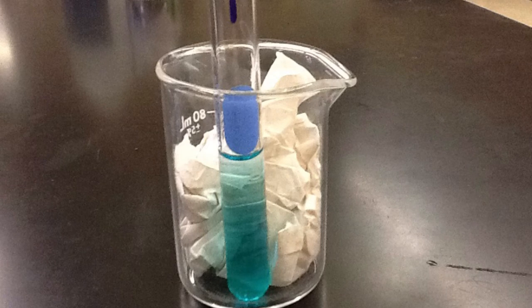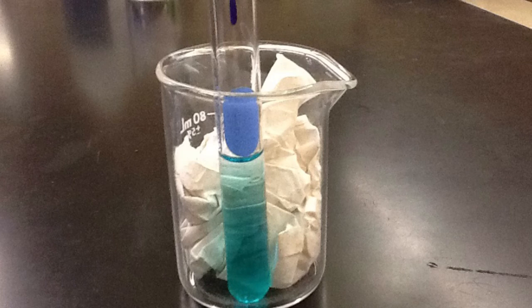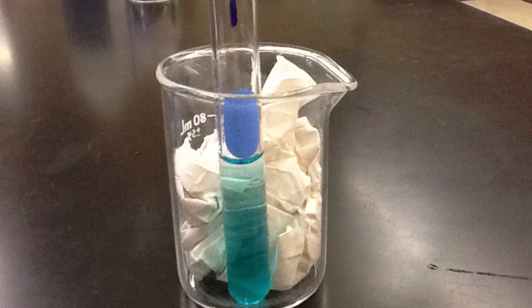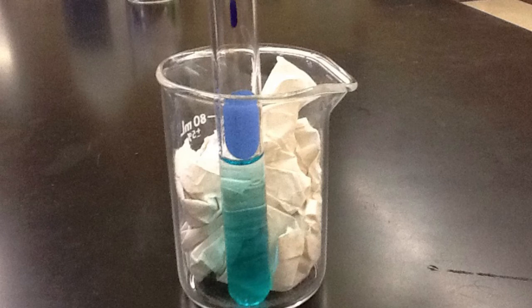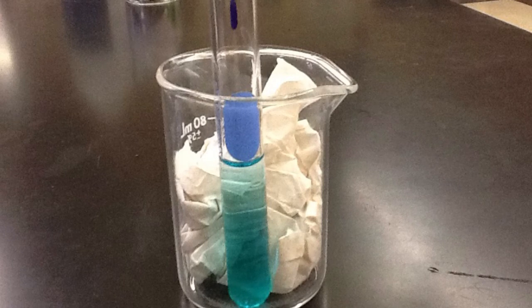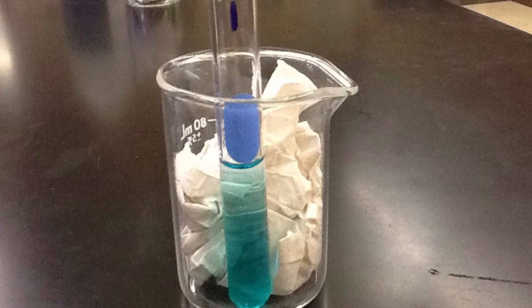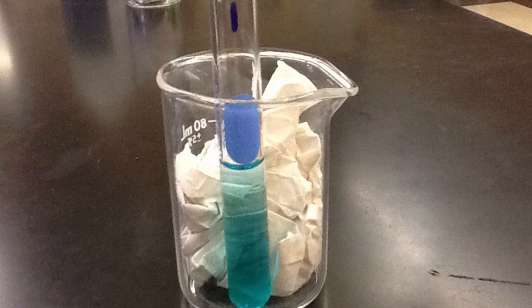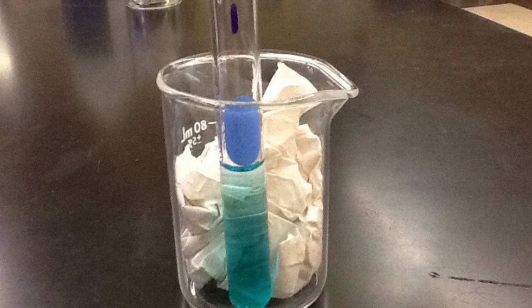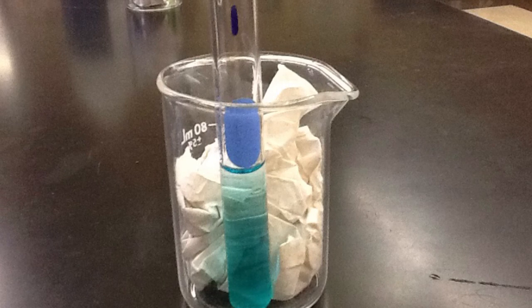So, I added water and it shifted left and turned blue. What color is the complex ion that contains copper surrounded by water molecules? Okay, so you can write blue under the formula of that ion. Now you get to practice your color theory skills. When both colored complex ions are present in large extents, the solution is aqua. When mostly the reactant ion is present, the solution is blue.